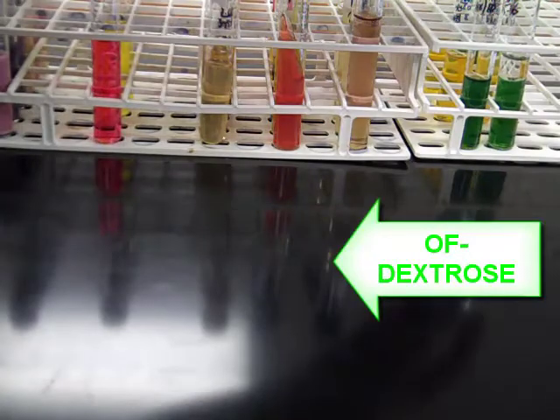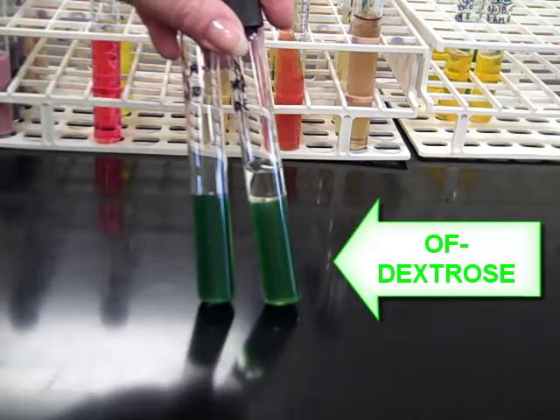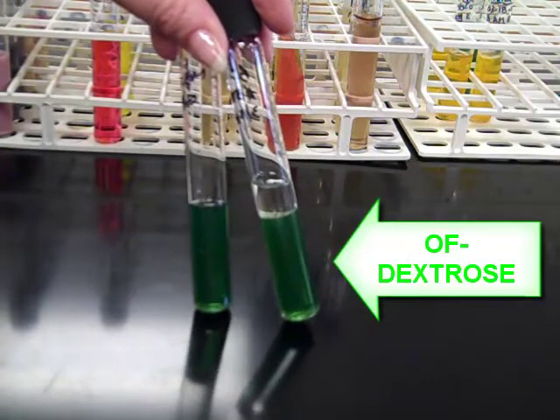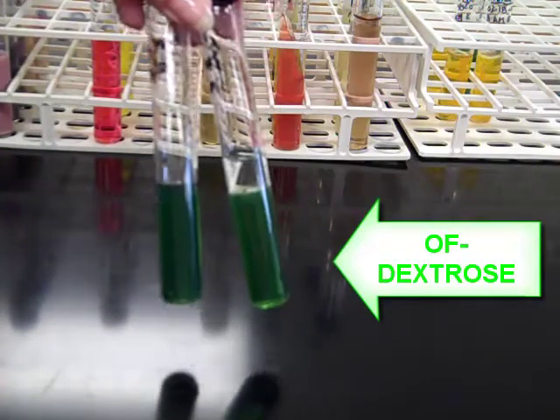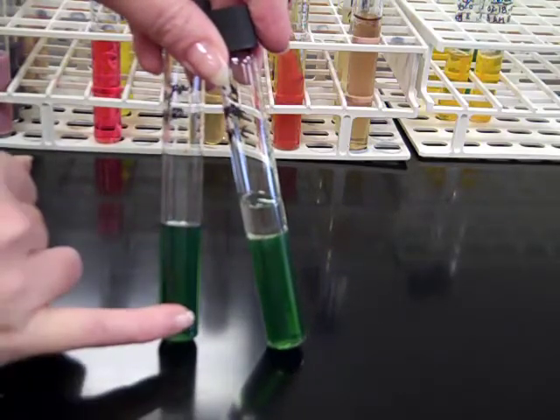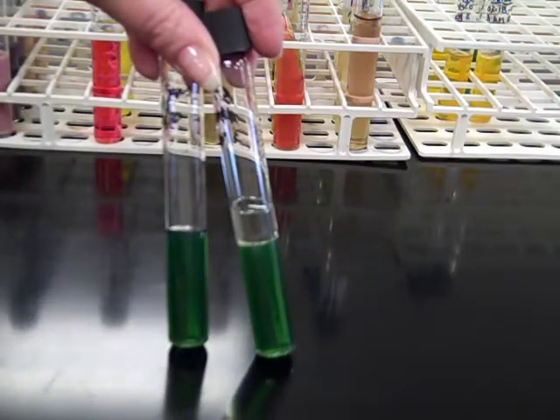And our last media of interest is OF dextrose. Dextrose is a form of glucose. These are always paired tubes. We have one tube that is exposed to the environment and one tube that we added sterile mineral oil to produce an anaerobic environment. It's a nice green color when uninoculated. Green means the organism is not able to oxidize the glucose, the dextrose, or ferment the dextrose. Negative.